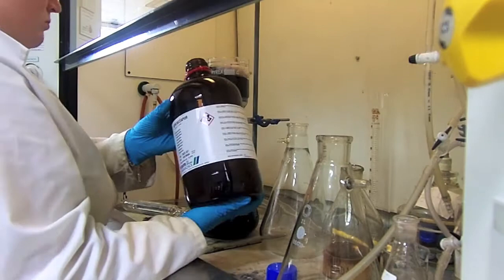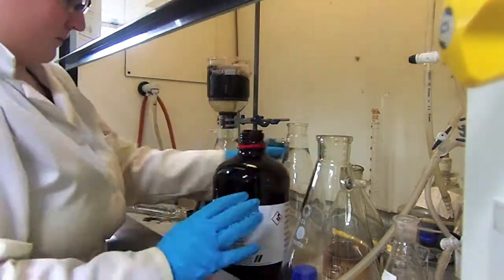Collect your sample in multiple fractions, changing flasks every time the flask gets over half full.